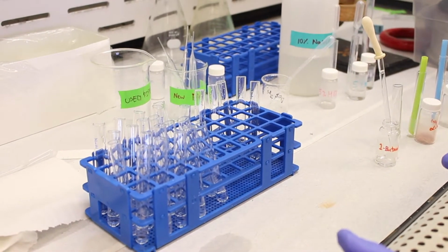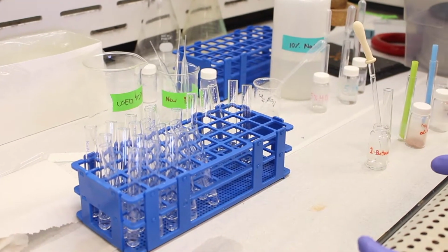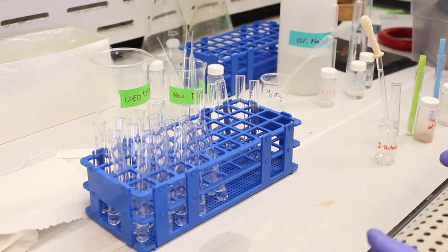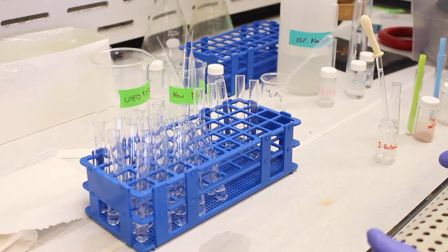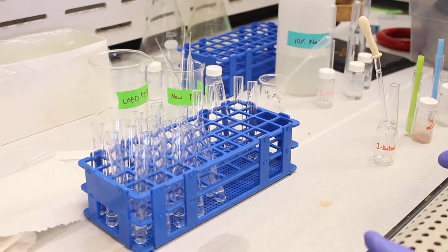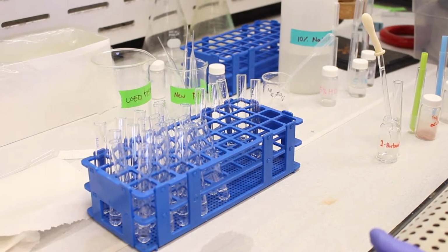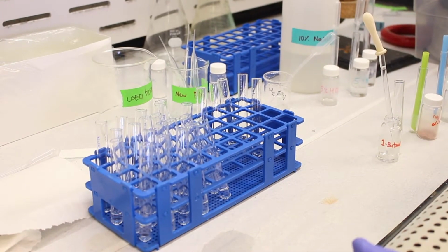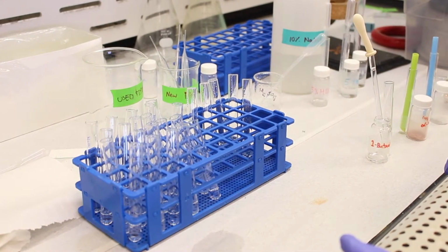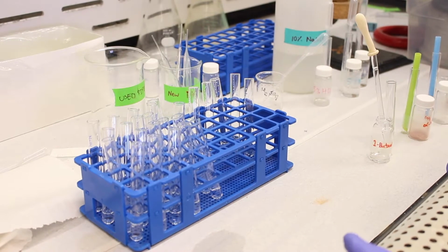This can, however, be changed if the functional group on the molecule can be ionized. So ionizable functional groups typically means acid or base. So if your compound has an acidic functional group, such as a carboxylic acid, it can be solubilized in water if that water contains a base. And vice versa. If the functional group of your molecule is basic, such as an amine, it can be solubilized by adding it to an acid. And that's something this lab will investigate.